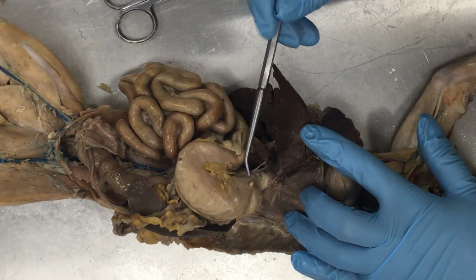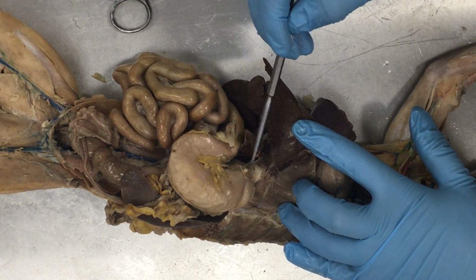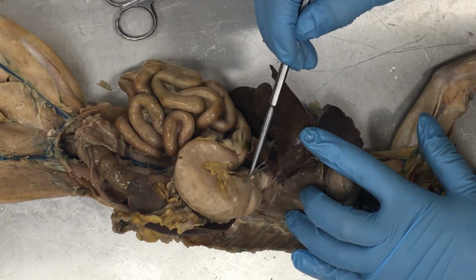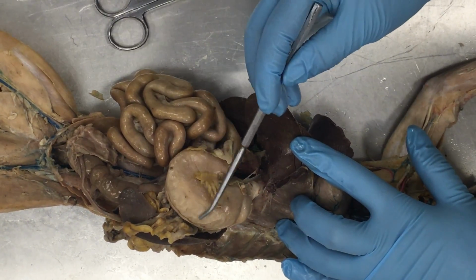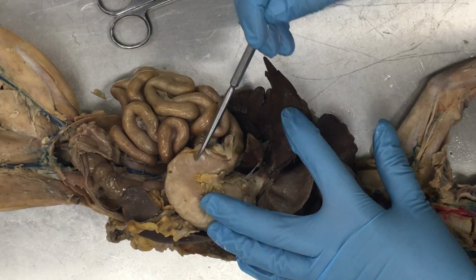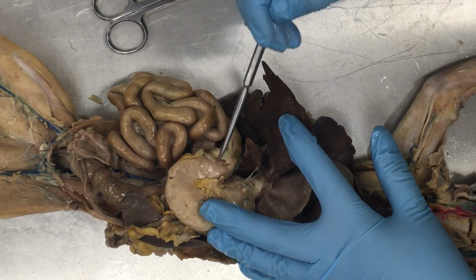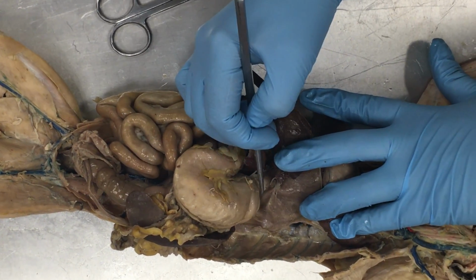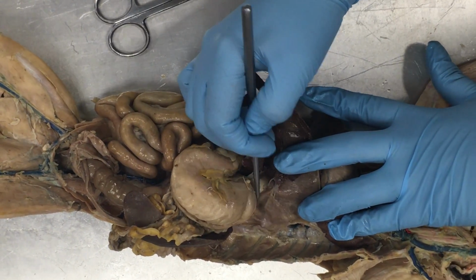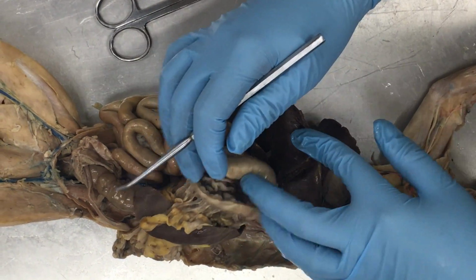The stomach has a couple different regions. The region right where the esophagus dumps into the stomach here, we call this our cardia or cardiac portion. The majority of the stomach, this sort of big open space, is called the body. And then this end bit where it sort of loops around, this is called the pylorus or the pyloric portion. Finally, there's also this curved top portion that's a little bit higher than the esophagus. That's the fundus.